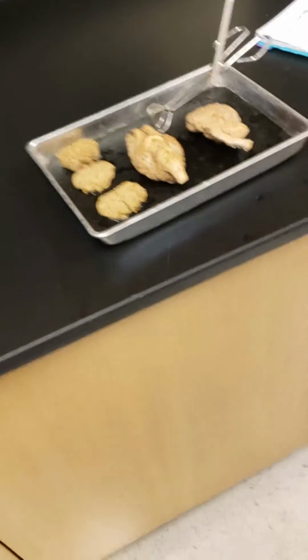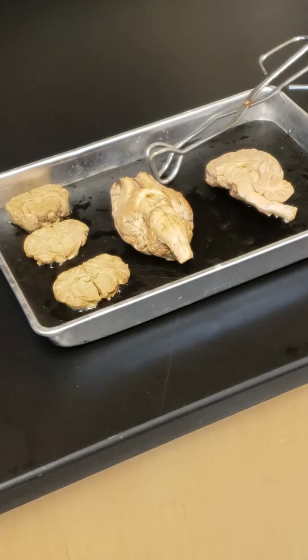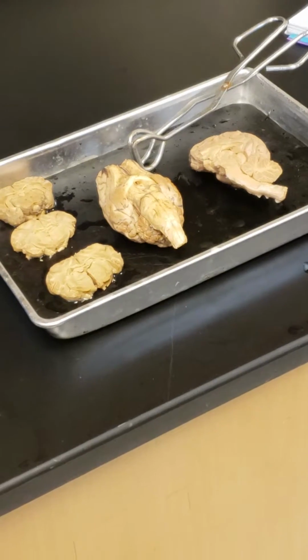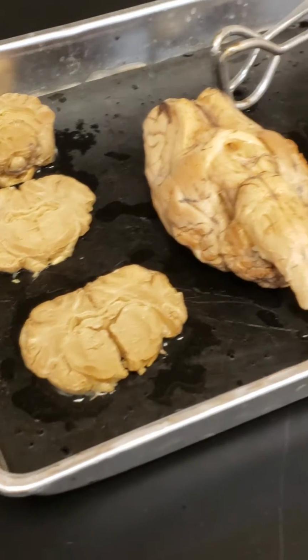Yeah, please. You want over here? All right. So, yeah, and I'll do it again. Unless, have you guys seen it? Deb, I don't think. Where did Devin go? She didn't see it. Are you guys gonna? I'm trying to figure this out. So go ahead. Okay.